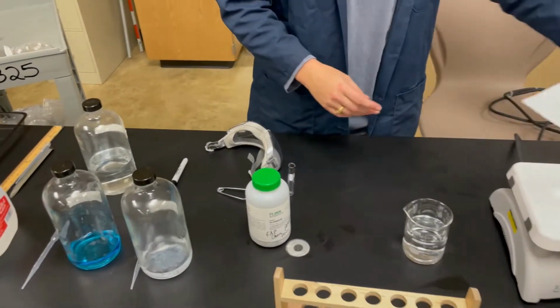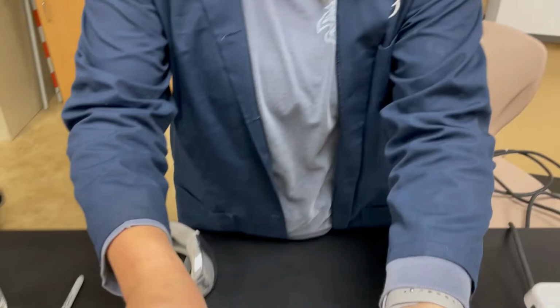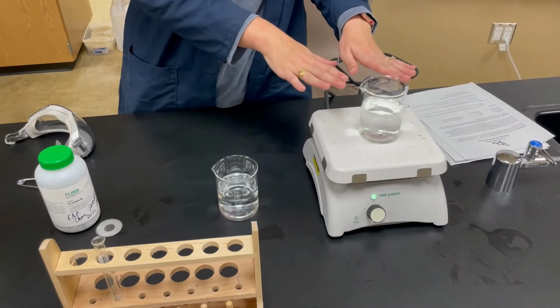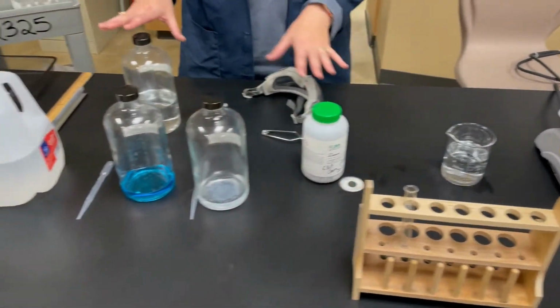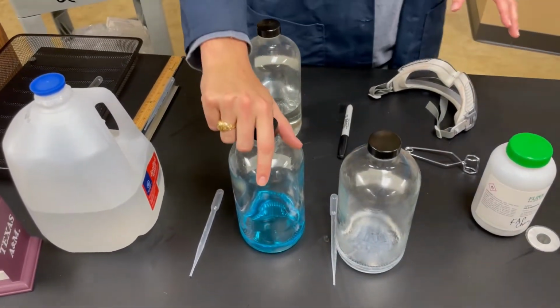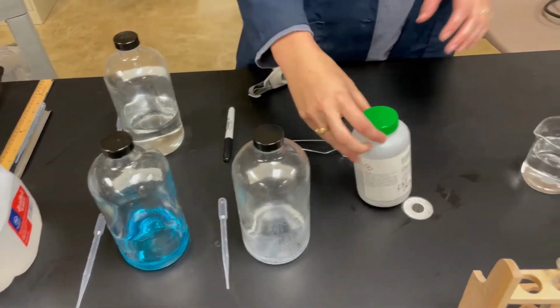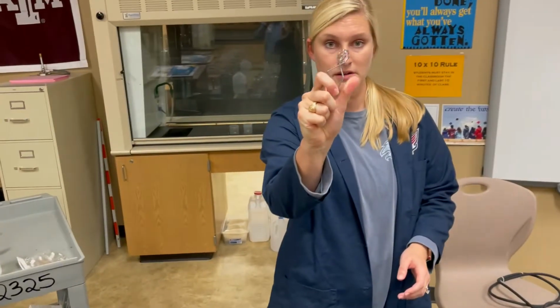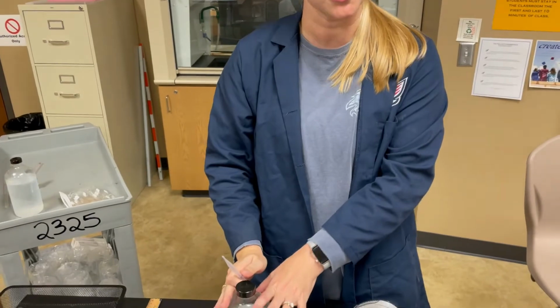So what I've got set up here, I've got a test tube where I'm going to do my reactions. I've got a test tube holder to hang on to it. I've got two 250 milliliter beakers. One is on a hot plate, so it gets warm, and that is currently heating up. And one is at room temperature, and it's my cool beaker. I also have several chemicals here. I've got HCl, which is hydrochloric acid. I've got copper 2 nitrate, and I've got sodium hydroxide. And then I also have aluminum pellets, okay? And then some tools: I've got my test tube tongs, and I've got some pipettes in order to get my solutions into my test tube.